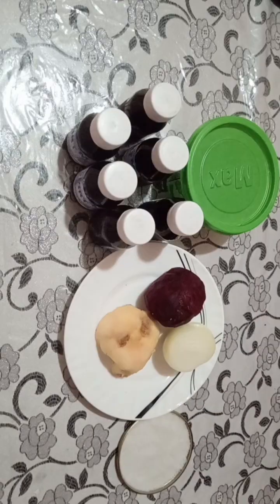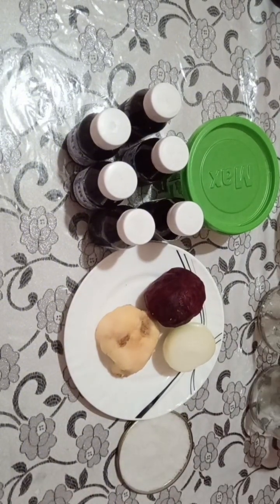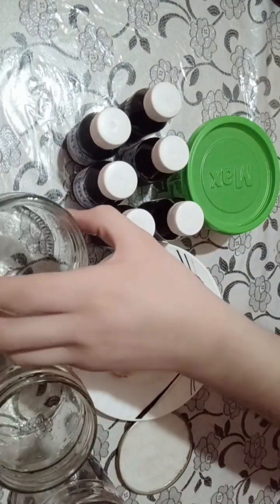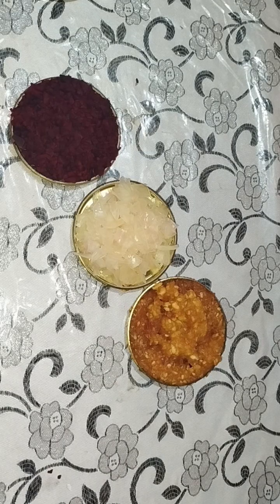Let's mash in 100 milliliter jars. However, each of your DNA extraction objects requires containers, and I choose 3 500 milliliter jars, and we can start our experiment. Let's go. We successfully divided our 3 objects, and then let's start the experiment.